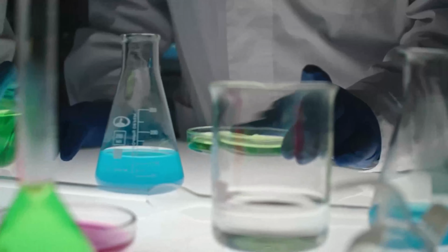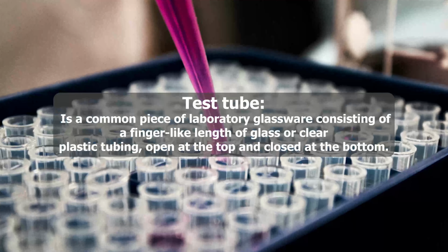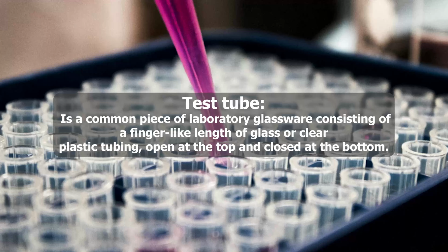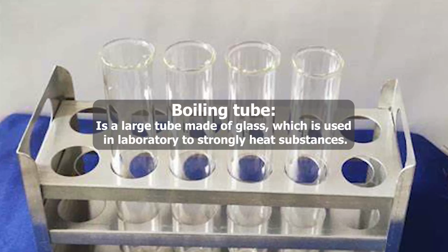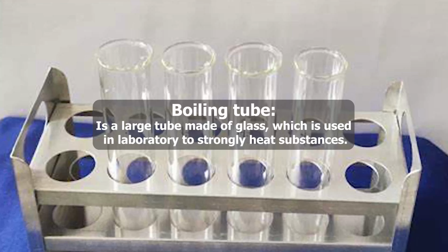This episode is about Chemistry Laboratory 1 Glassware. Test tube is a common piece of laboratory glassware consisting of a finger-like length of glass or clear plastic tubing, open at the top and closed at the bottom. Boiling tube is a large tube made of glass, which is used in laboratory to strongly heat substances.